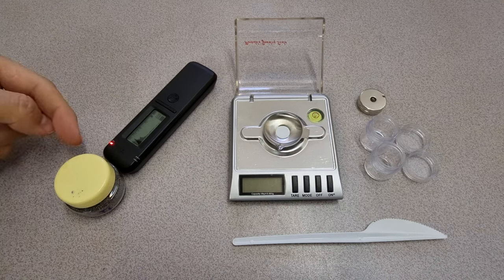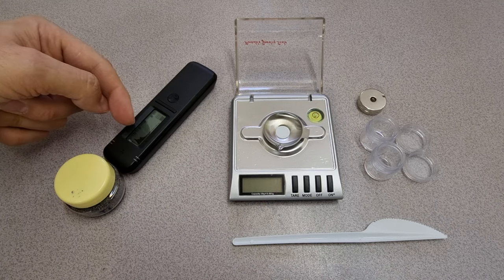I have our confirmed radioactive black sand from Kerala and here you can see the spectrum.